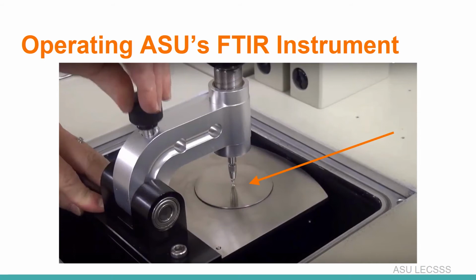Then you adjust the number of background scans to your liking, and once the blank has been run, you can vent the system. Then you can lift the lid straight up, take a very small size of your sample, so that's just enough to be over the diamond. Any extra is really just unnecessary, just gives you a higher chance of contaminating parts of the machine. So you only want to use what you need to use.